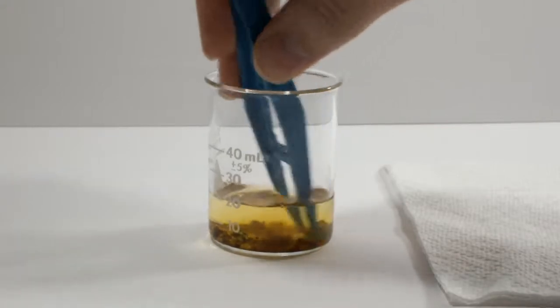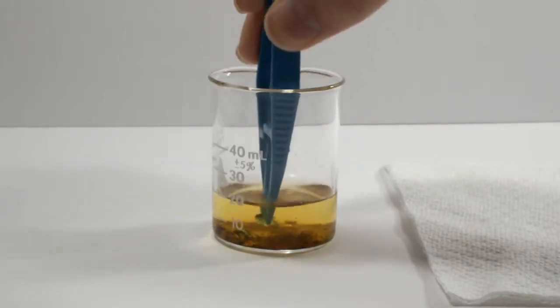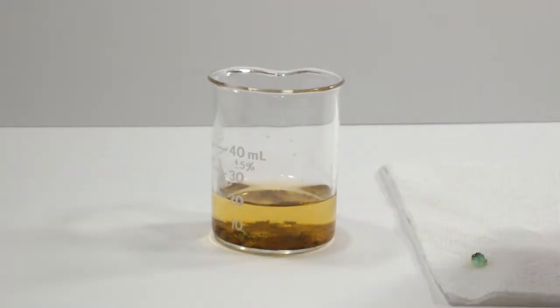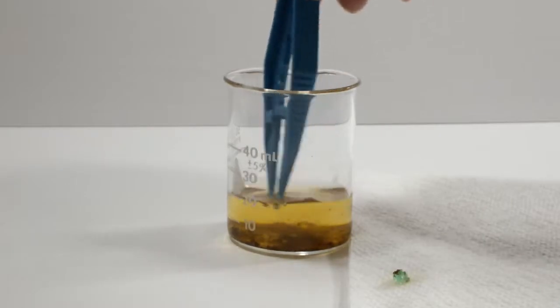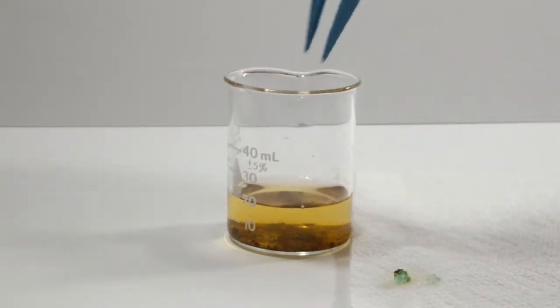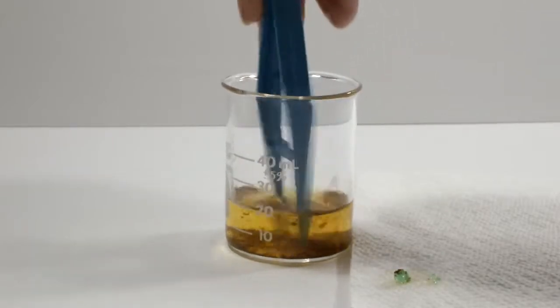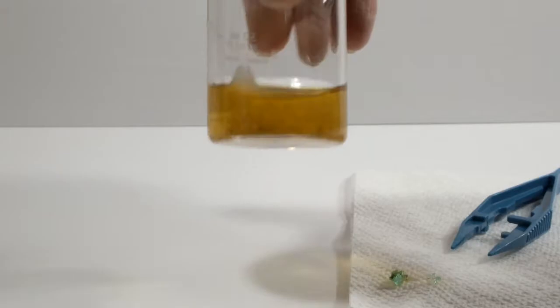The iron 2 chloride is very soluble in water, so this recovery method has substantial losses built into it. Not to mention, it's a pain. What I'd like to do is try a few other solvents and see if I can get the gunk free without dissolving the iron chloride. First, I have to get the brick out of the bottle. I'll let you in on a little trade secret.